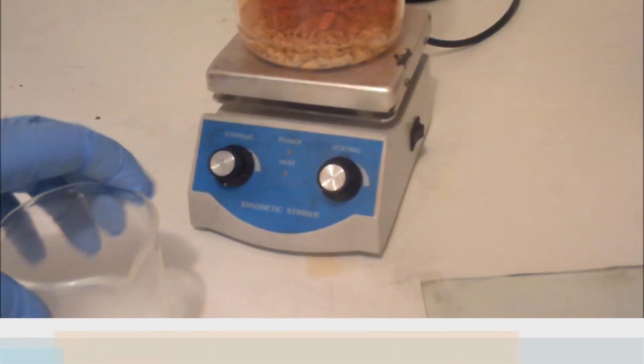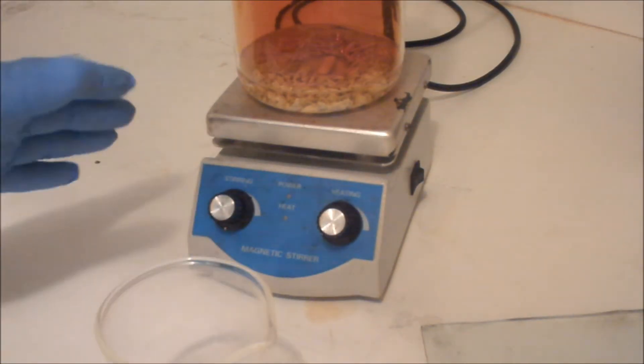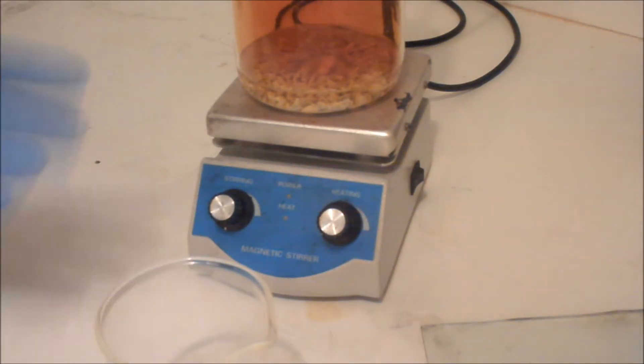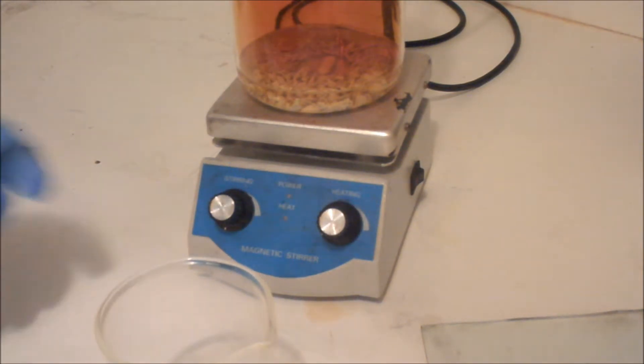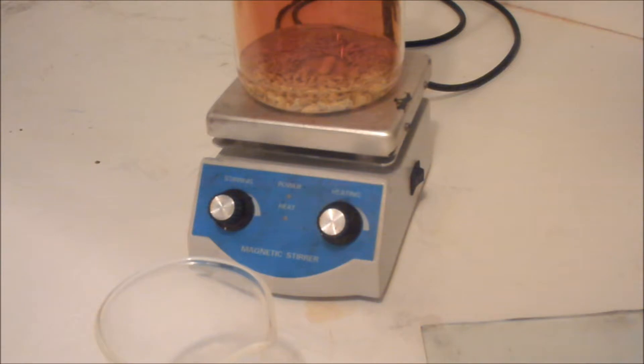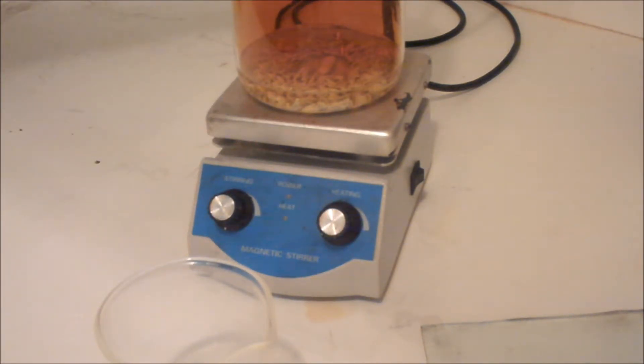Hi guys. The lead has been nitriding inside the beaker for a couple hours now. I think it's pretty good - I haven't seen too much more progress.